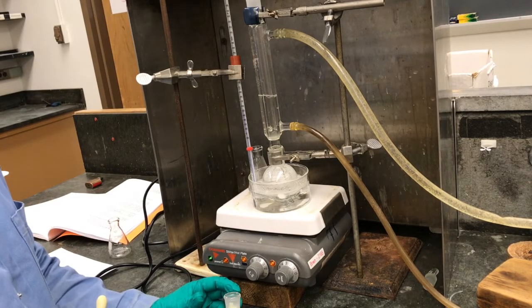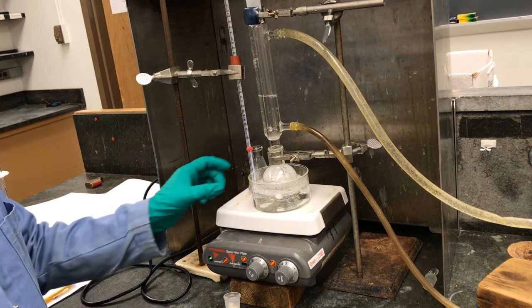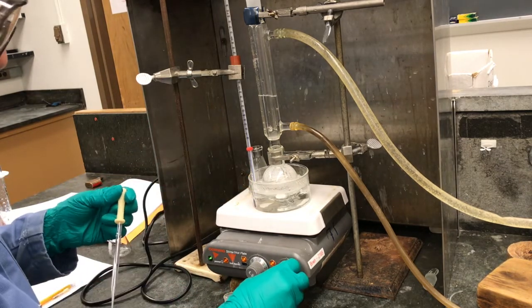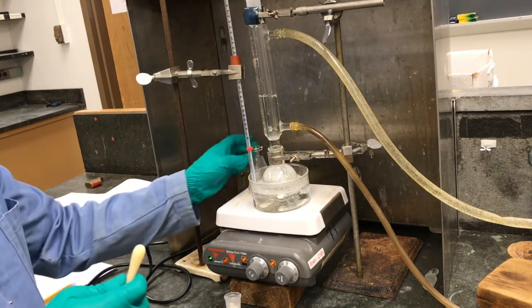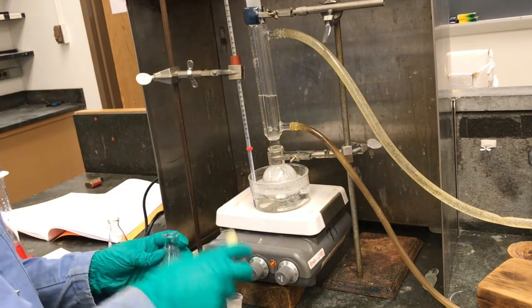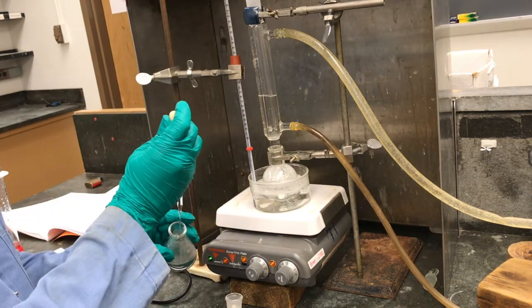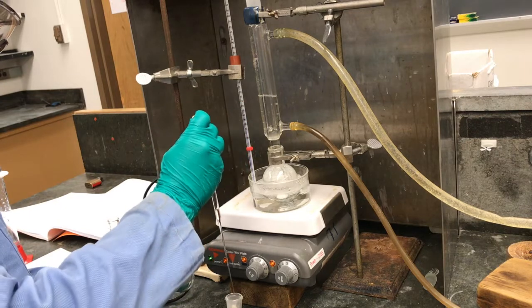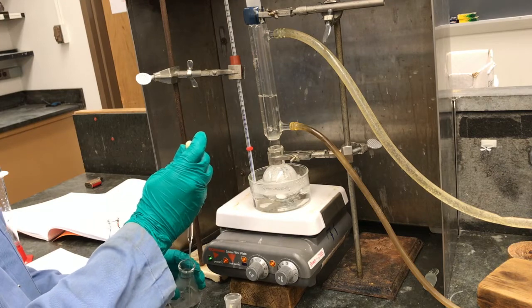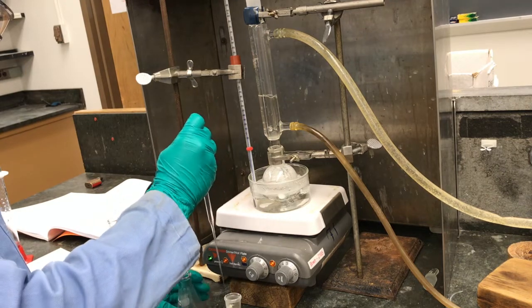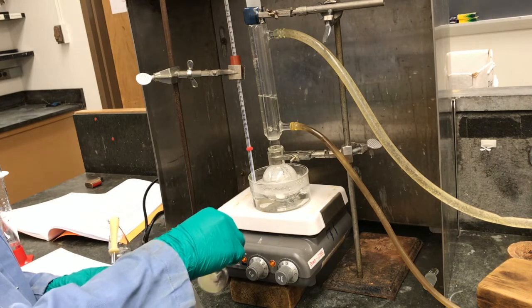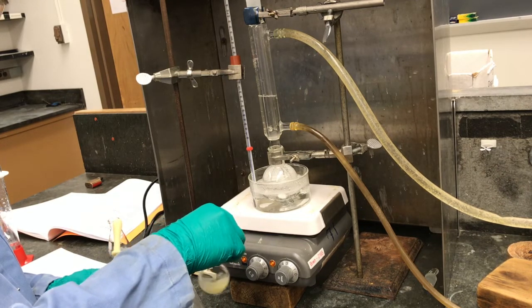Here we have the elevated temperature set up. We've got boiling water to heat the reaction, and right now it's right around 60 degrees Celsius. So we've got the p-nitrobenzaldehyde, and I'm going to try to dissolve it as best as I can with hot methanol. And we might not get it completely dissolved, we just want to get it as dissolved as possible, and then we're going to start adding it to the reaction.